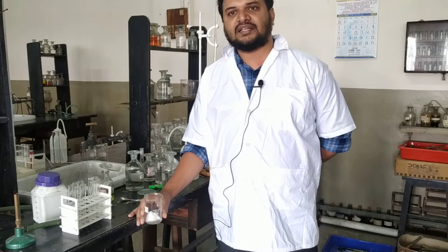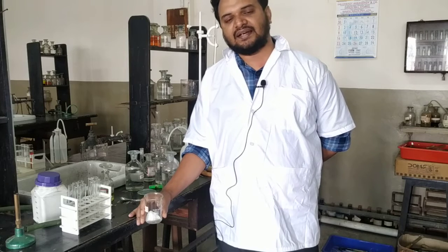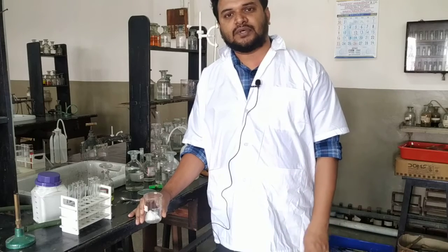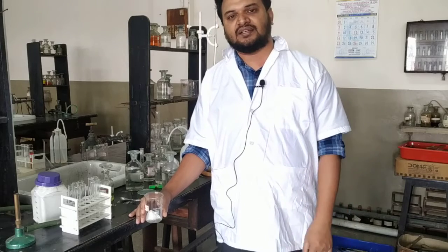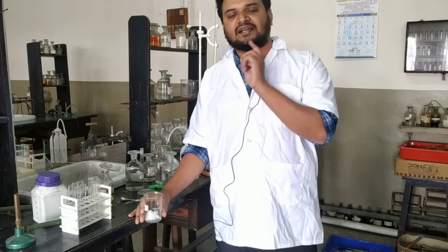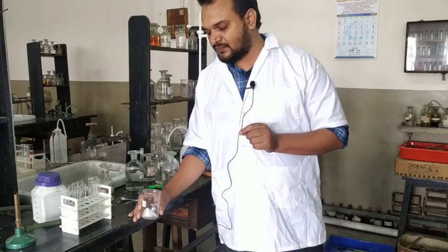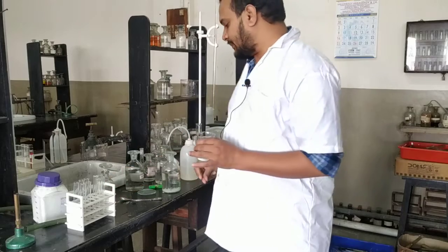though it is not necessary to prepare sodium carbonate extract for a soluble salt, it has the added advantage that if you have been given a nitrate salt of cations like Pb2 plus or calcium 2 plus, strontium 2 plus, barium 2 plus, then in the ring test of nitrate, that cation will hamper. But if you prepare sodium carbonate extract, in the extract the cation present is sodium, not your experimental Pb2 plus, Ca2 plus or strontium 2 plus cation. So that will not hamper in the ring test. That is why, since we don't know what anion is there, it is always better to prepare the sodium carbonate extract.